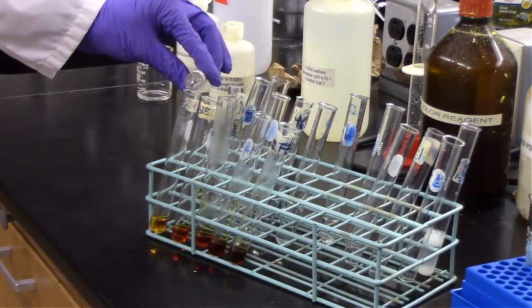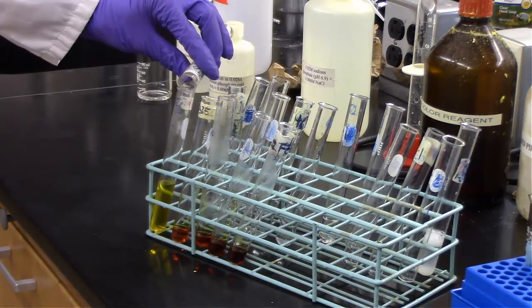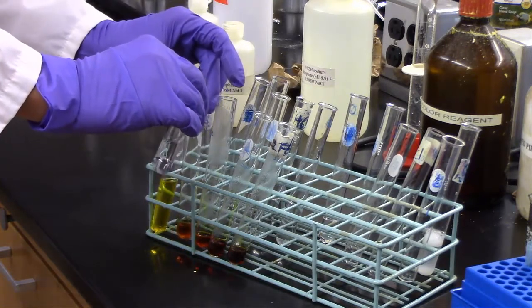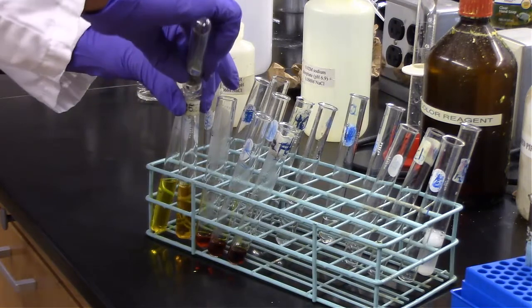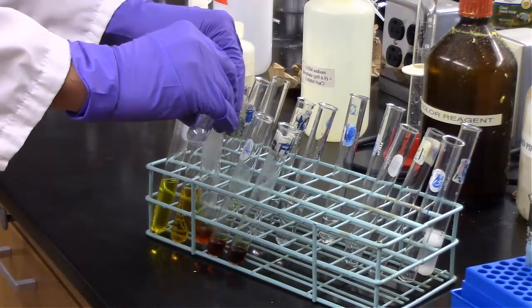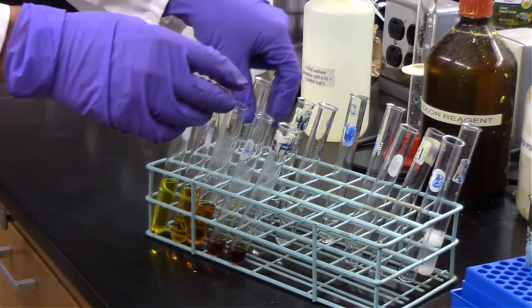And now that they've been in the hot water bath for 5 minutes, we're taking them off and adding the 8 milliliters of water to each test tube. And you can actually see the difference in color between the more concentrated samples. So of the 2 milliliters that was in there, it obviously gets lighter to darker. It just basically lightens up all of the colors a little bit more once we add in our water.